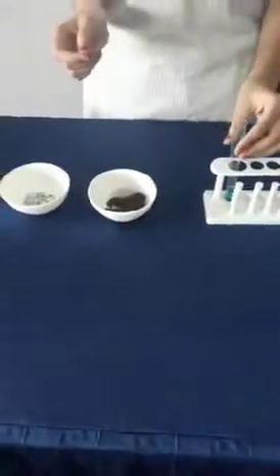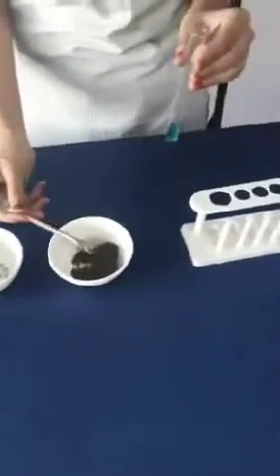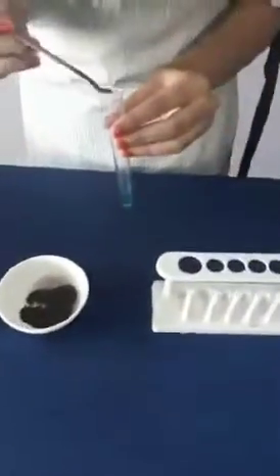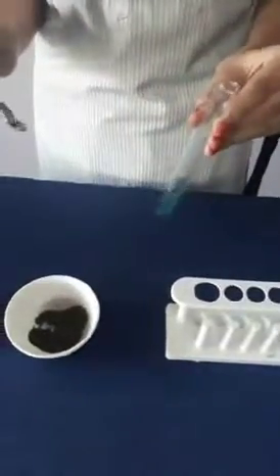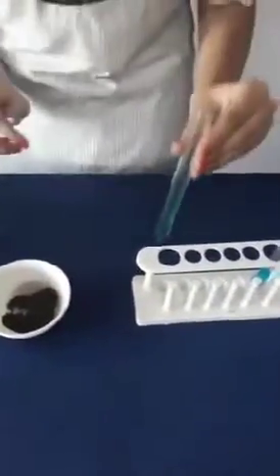Take test tube A, put some iron in it and put it back.